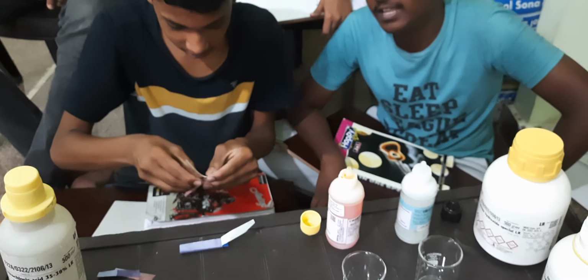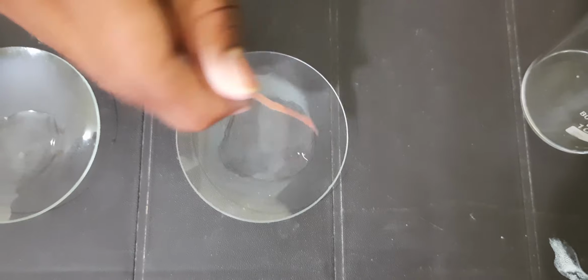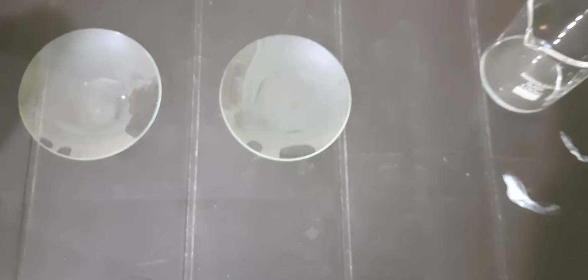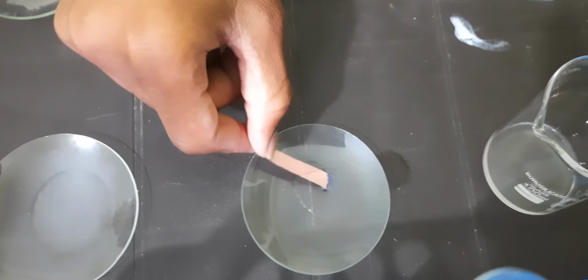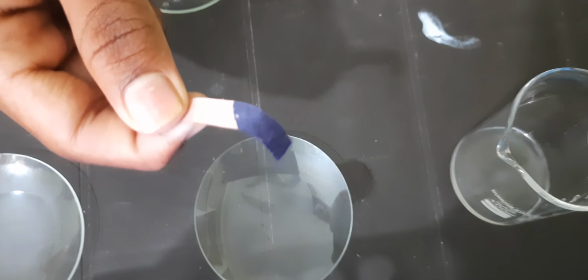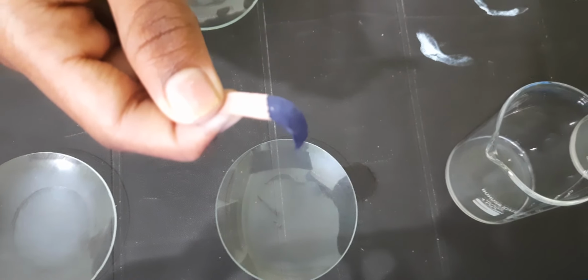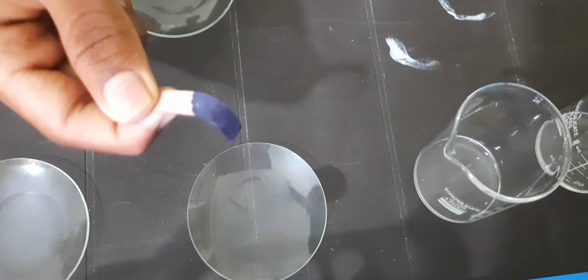Take the red litmus paper and check the response of acid and base. Is there any response of red litmus paper in acid? No. Okay, take it back. Don't put it on the table, it may react and there may be a change of color. So now the response of red litmus paper in base, that is sodium hydroxide. What is the color? Blue. So what can we say? The red litmus changes to blue in basic solution.